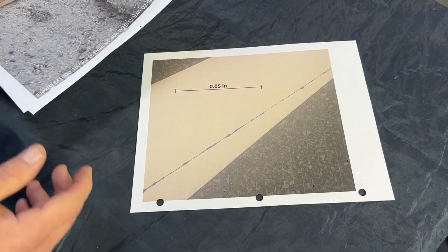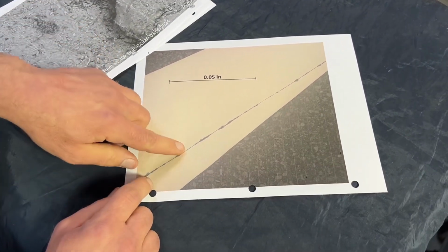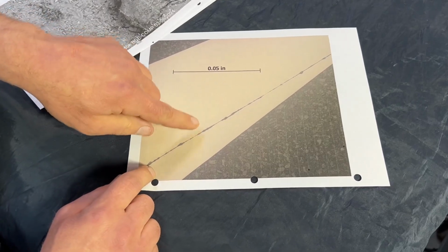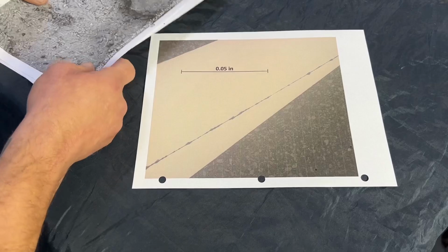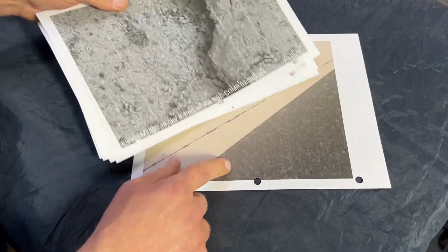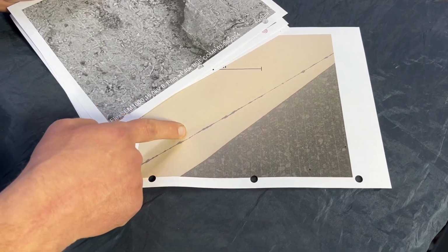But I have a question. Sure. Is that like an air pocket or is it a different type of material? It's some sort of material in there. So what's going to happen now that they've gotten into this, they're going to zoom in really close like they did here and start inspecting that to see compositionally exactly what that is.